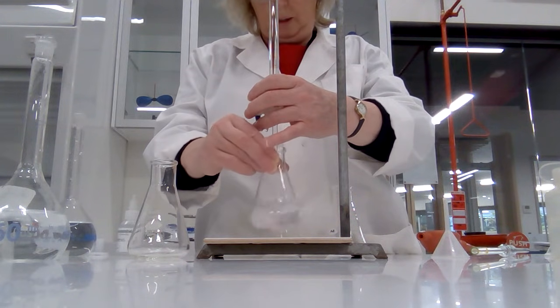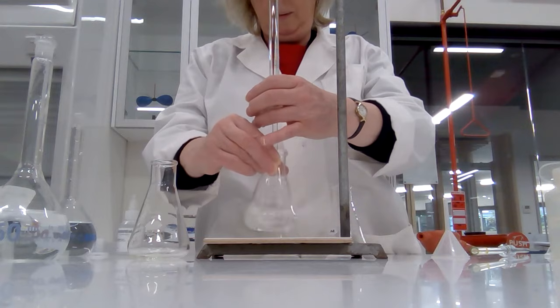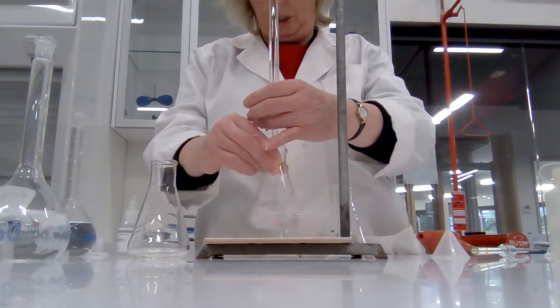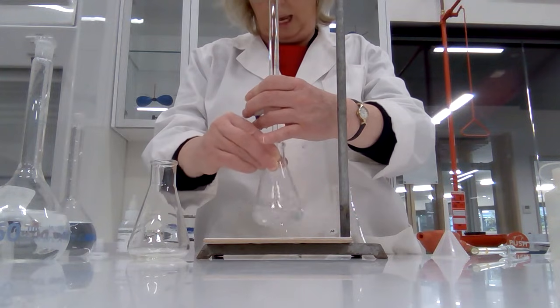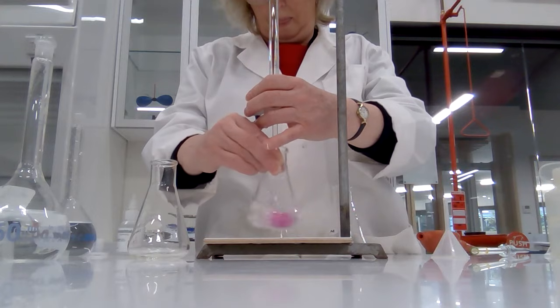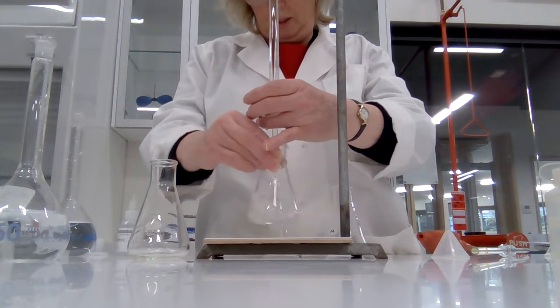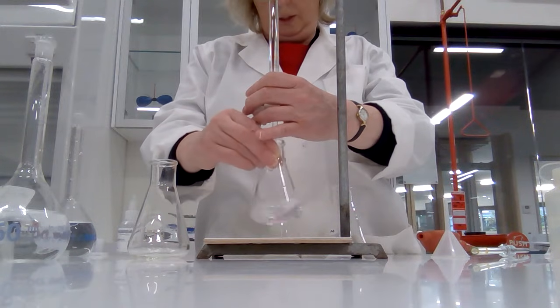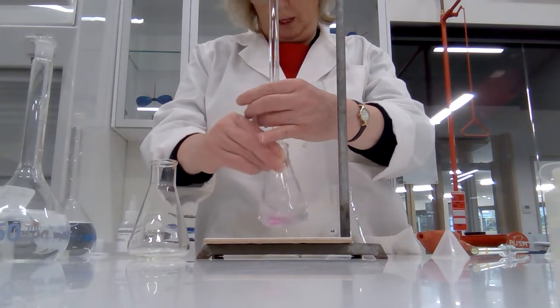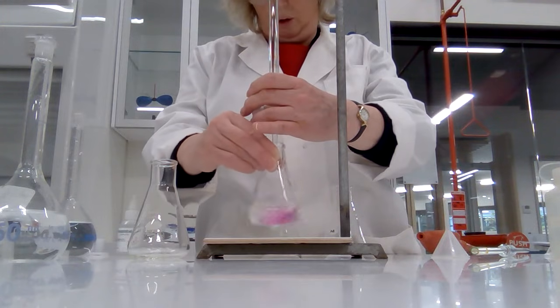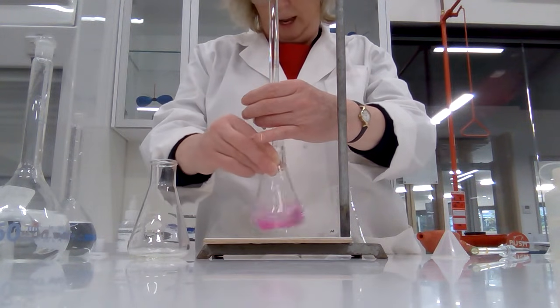A bit longer. I've got a distinctly damp feeling around my fingers which suggests that this burette is leaking, which makes me very sad. I'll try and get it done as quickly as I can so that I can mitigate the damage of a leaking burette on my results. There we go.